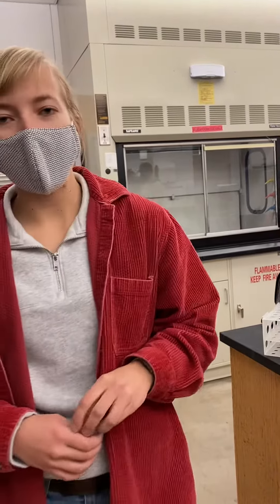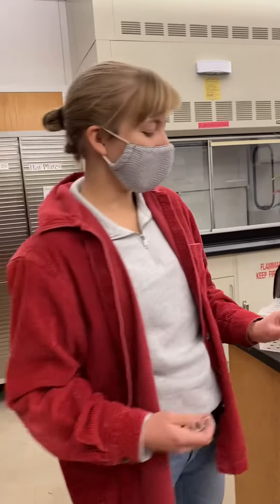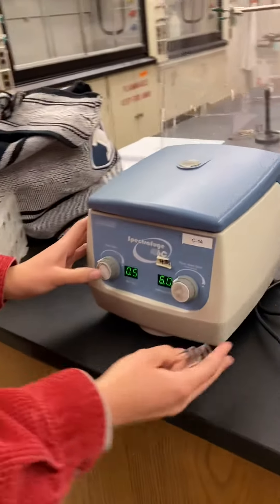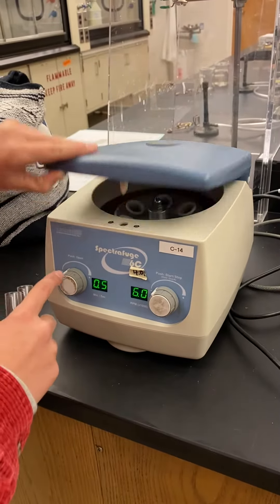All right, so we're going to be going over how to use a centrifuge. First, we're going to look at it, push this button that says push and open.